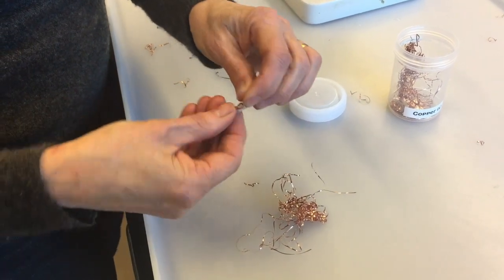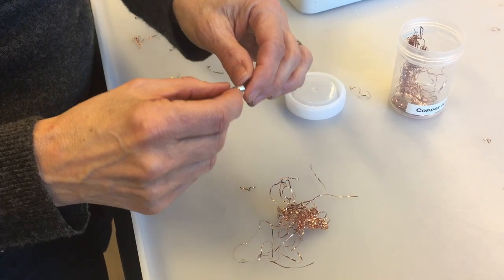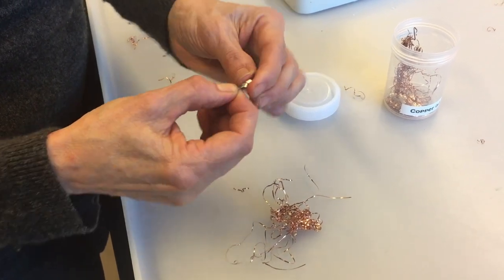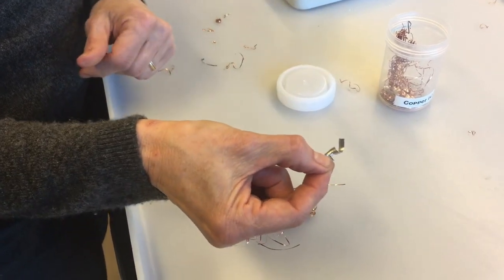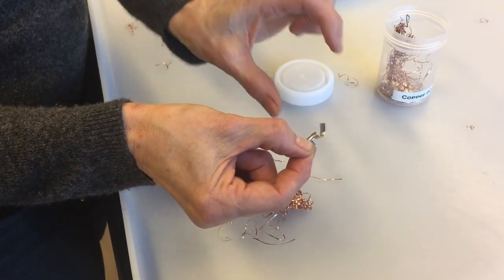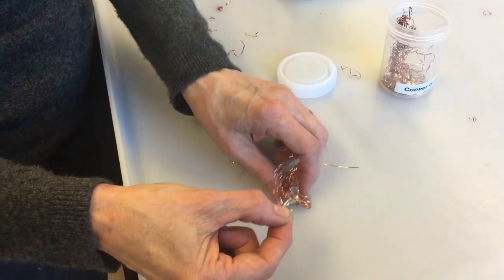If you make it into a tight coil, it's going to take your experiment a lot longer to finish than everybody else's. So it's important that you don't make it into a tight coil. But I made it into sort of a loose coil. Before it was just a big long piece, now it's a loose coil. That helps it stay tucked into the copper a little more easily.